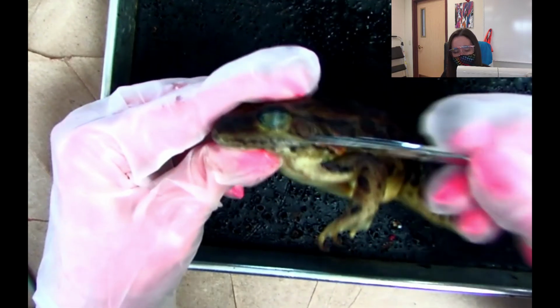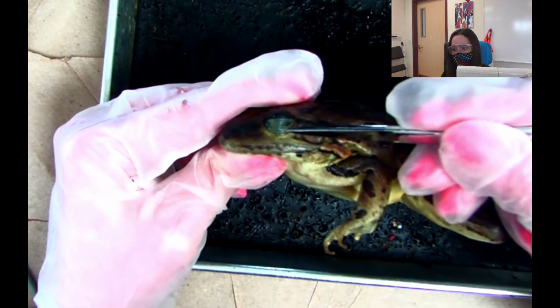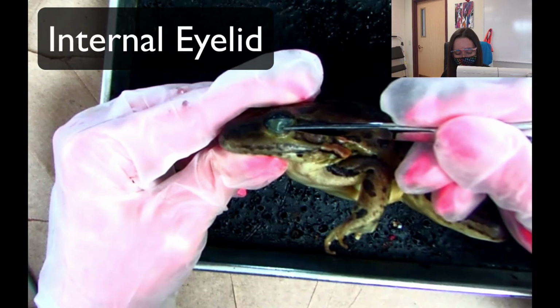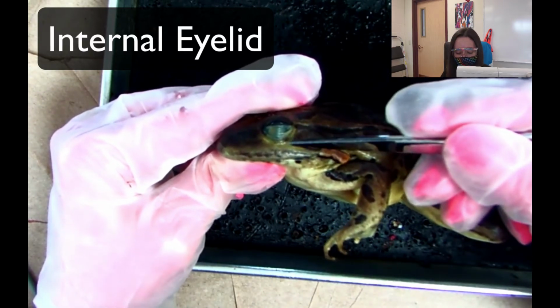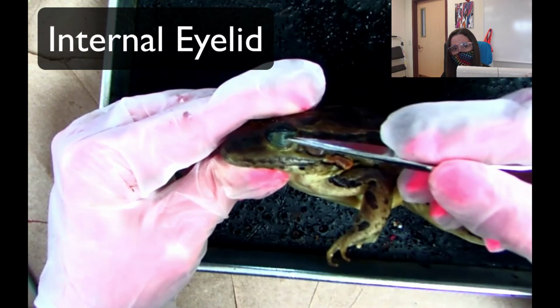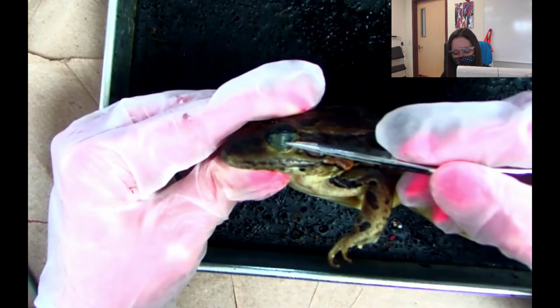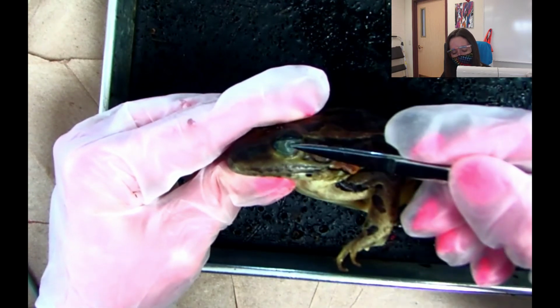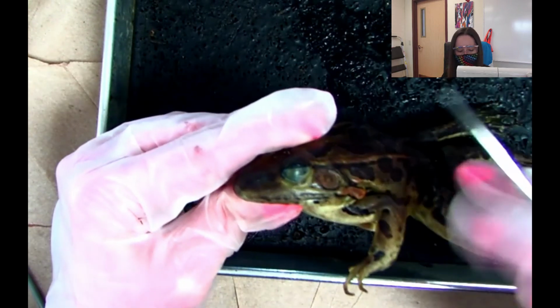The next part that we're going to go over is this clear part that's over the eye. The clear part that is over the eye is called the internal eyelid. This acts as just an extra protective layer for the eye. Some amphibians have this, and also some reptiles. It just gives them that protective layer. I do know that alligators and crocodiles have this, and it's pretty cool. It's like an extra set of goggles for them.